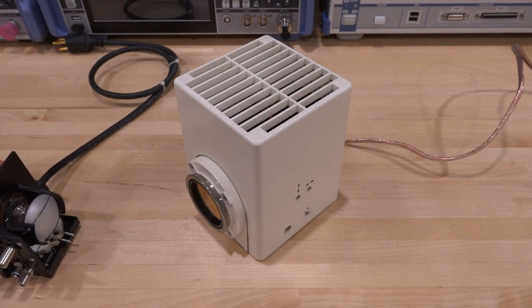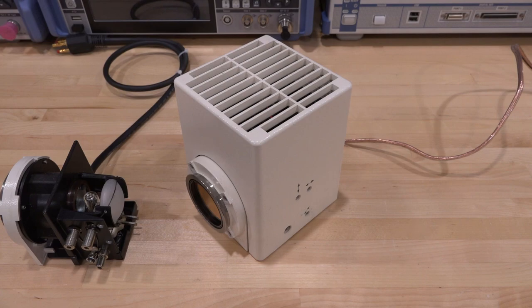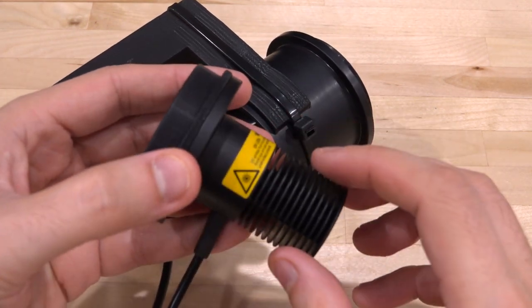A couple of people suggested one LED that I could buy that was really, really bright in a single kind of point source. So I went and I bought that, and I looked around for a housing for it, and Thorlabs actually has one of those. Let me show you what it looks like. So here's what we have. I've taken it apart so you can take a close look. So this is the chassis of that LED.